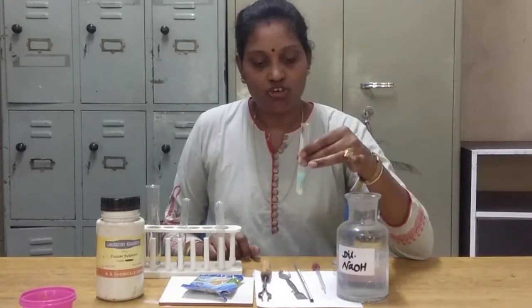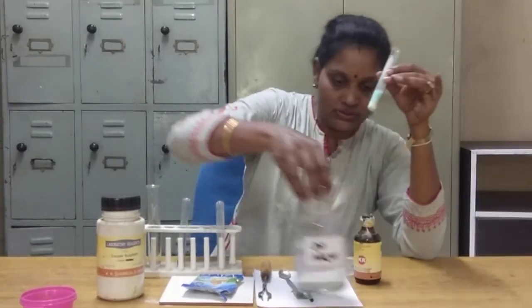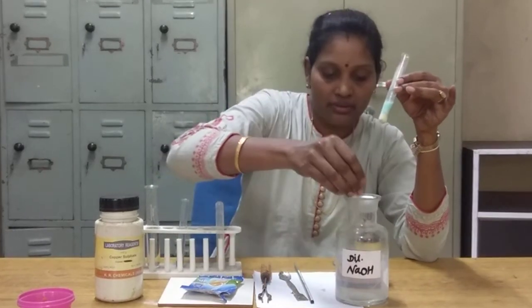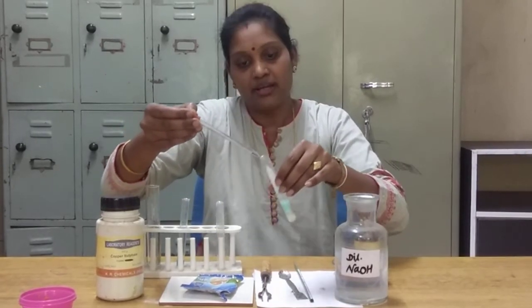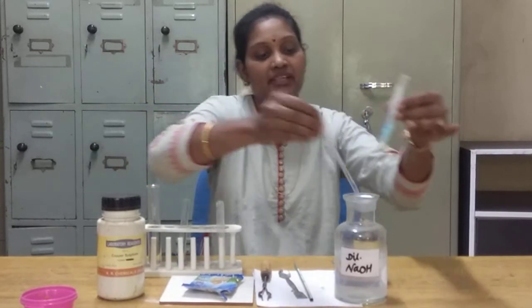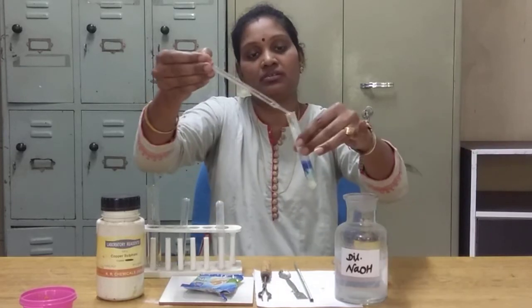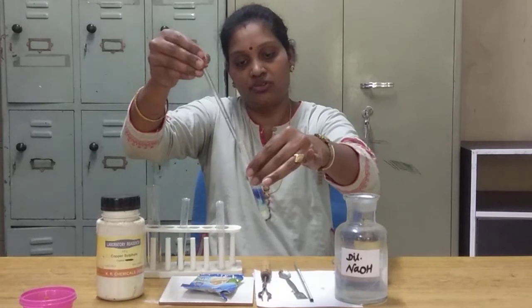The next step is the addition of sodium hydroxide. This is dilute sodium hydroxide solution, which is also caustic soda when mixed with water. Now I am adding ten drops of sodium hydroxide.